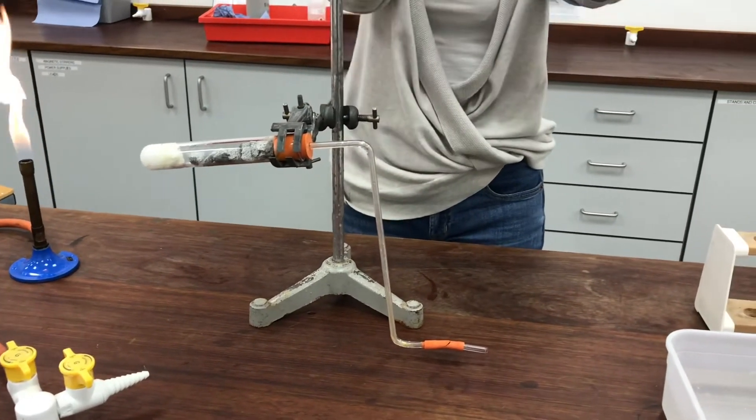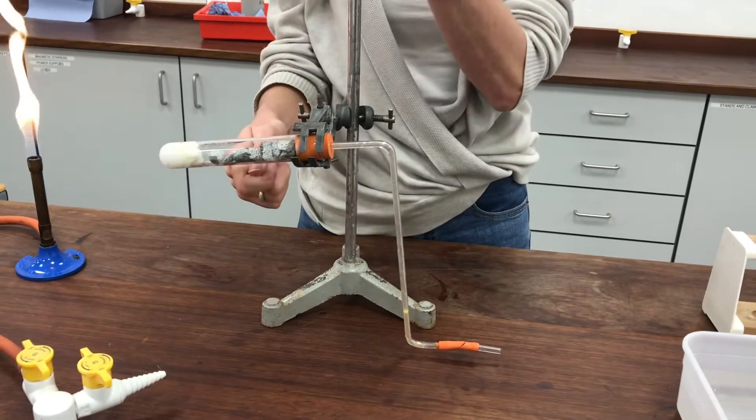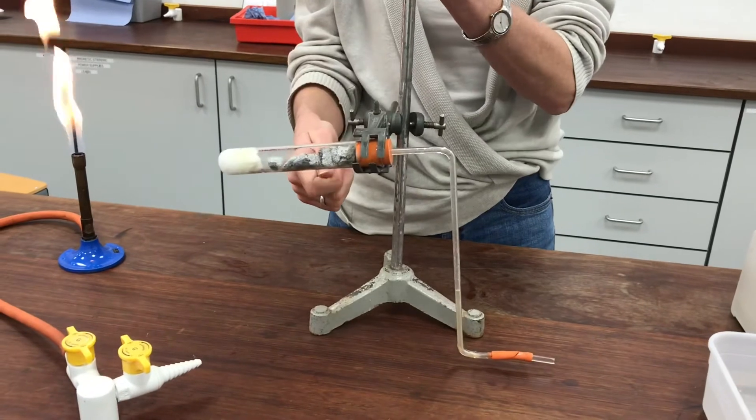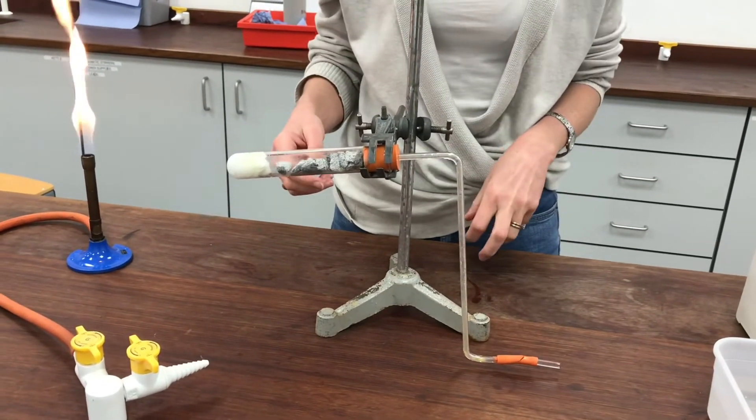Neither of which is the situation I really want. So as I got to the end of the experiment I carried on heating and I lifted the whole apparatus up by the clamp stand and lifted it right out of the water so that as it cooled it was in the air and I didn't need to worry about that.